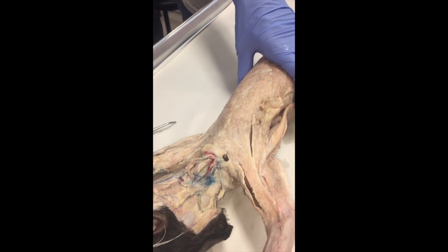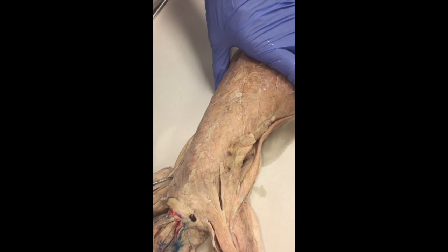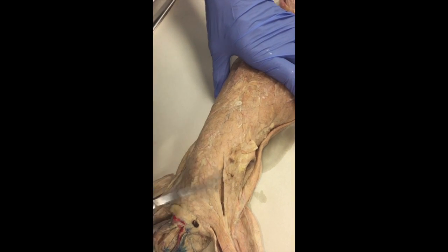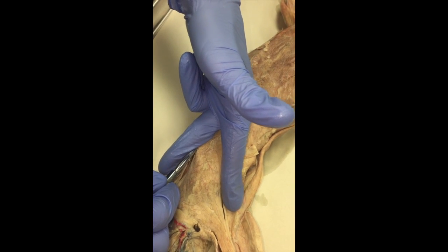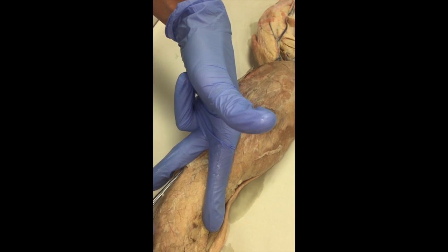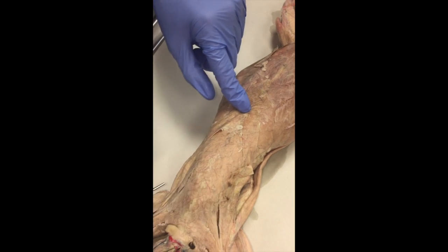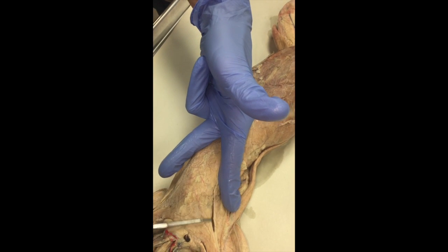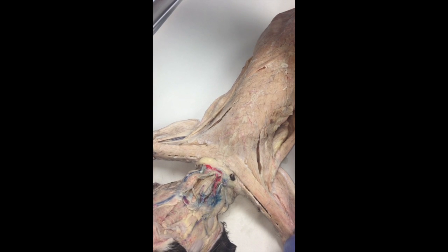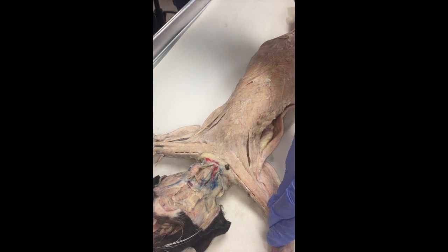Going down into the thoracic muscles, we have the pectoralis major, which is this top triangle here. Then we have the pectoralis minor, which is this chevron right here, this V-shape. And then we have another V-shape right under that called xiphihumeralis, because it starts with the xiphoid process and goes up into the humerus of the arm — that's where it attaches. So xiphihumeralis, pectoralis minor, pectoralis major. And then if you hold the arms back, the pectoantibrachialis pops right out and goes across the pectoral and brachial regions.